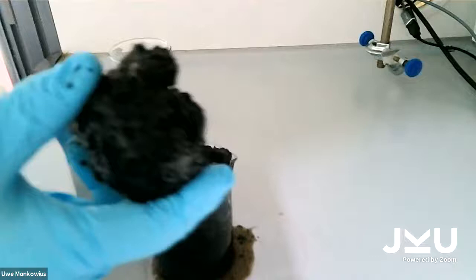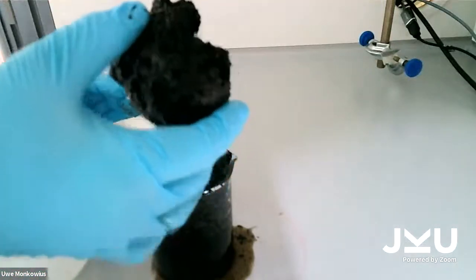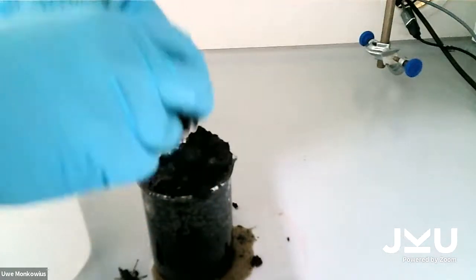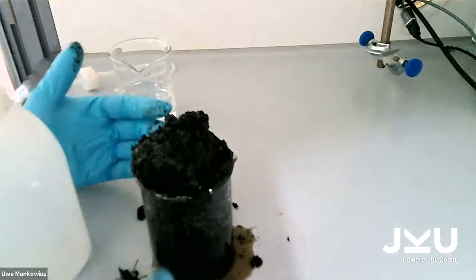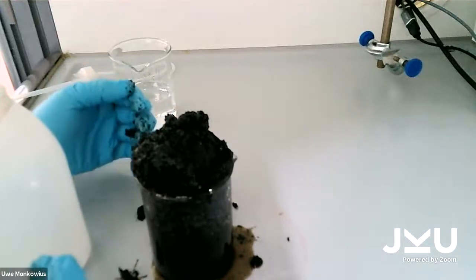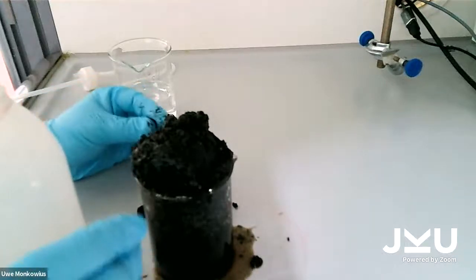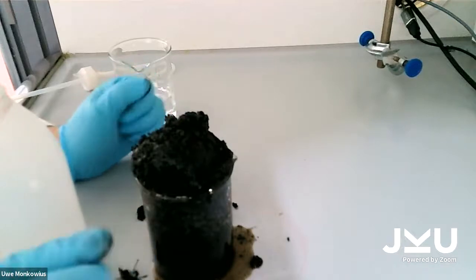And it's funny because when you do this experiment with pure sugar, the black mass is really hard, but here it's almost like a gummy bear, so it's really squishy. The reason for that is that the gummy bear doesn't only have sugar, but also other stuff inside that makes them flexible. Now, while I clean up this mess, you will see again the beautiful patterns, and then I'll show you the next experiment.